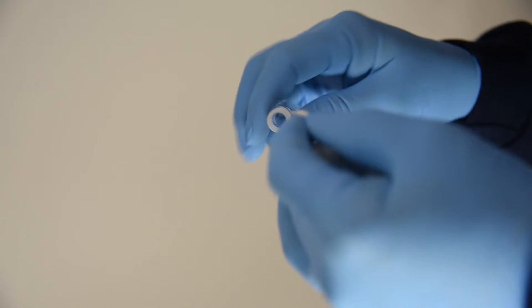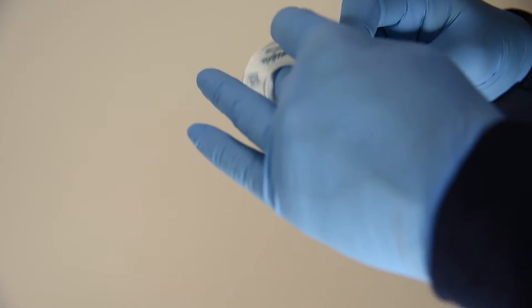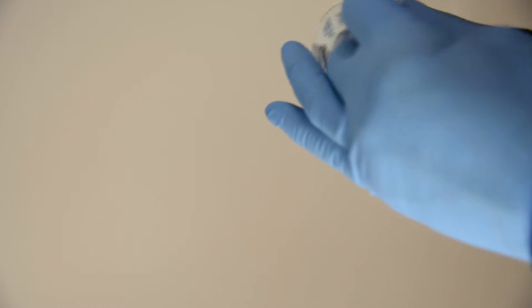So we use a quarter inch wide. So you want to put a little bit of teflon tape on the threads. I would say probably three, let's go with four wraps.